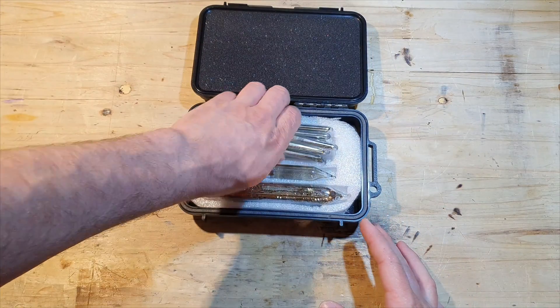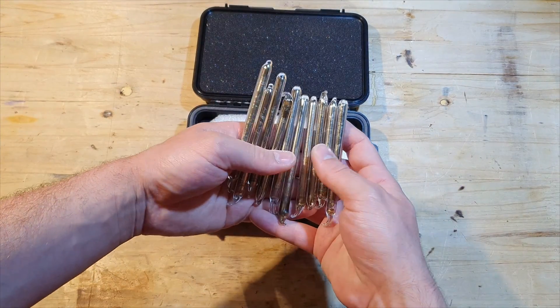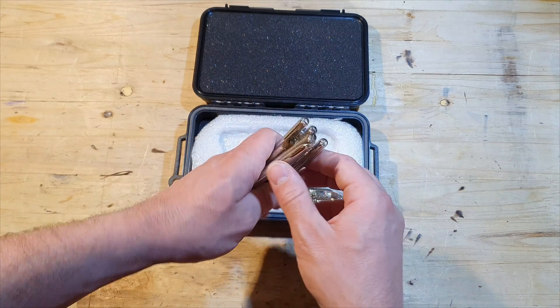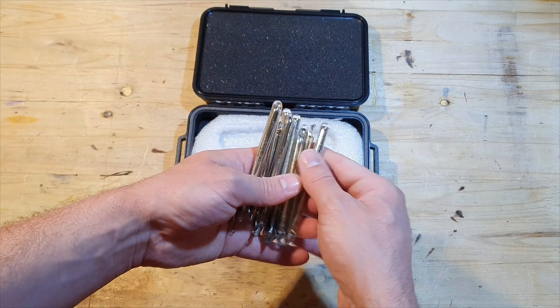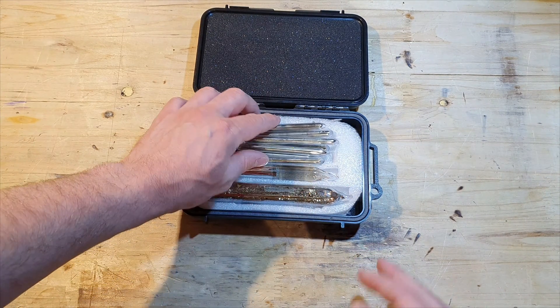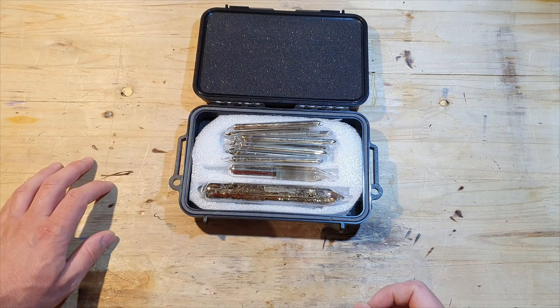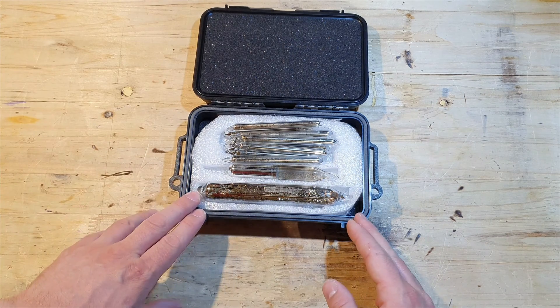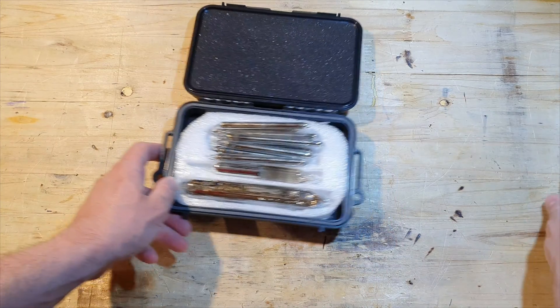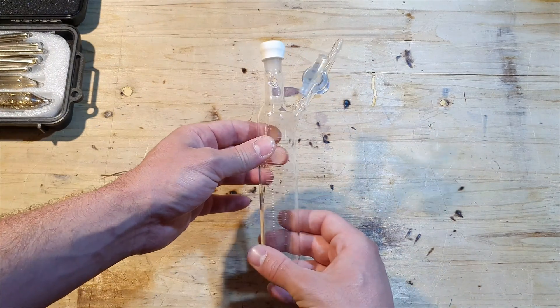As you can see, I already made a good amount of cesium. These are ten vials containing two milliliters of cesium each, so four grams of cesium per vial. But we wanted a little bit more cesium for smaller scale experiments, so I'm going to make some cesium today that I'm not going to fill into a vial, but rather use a Schlenk flask or a Schlenk tube like this one.